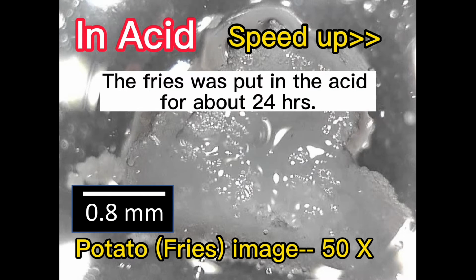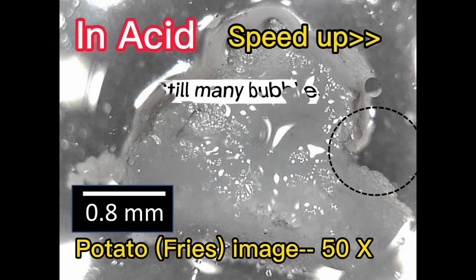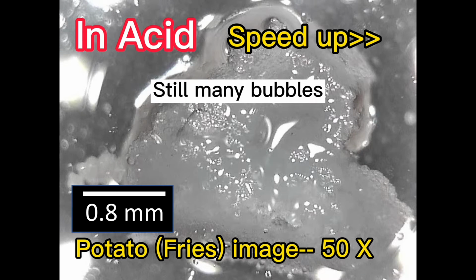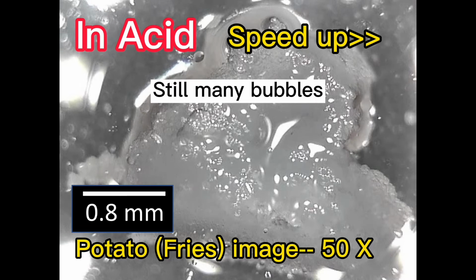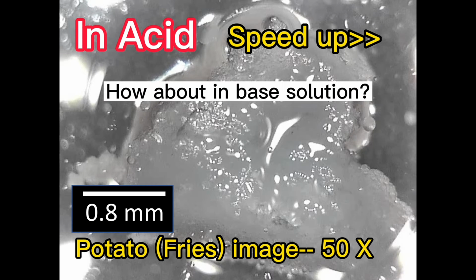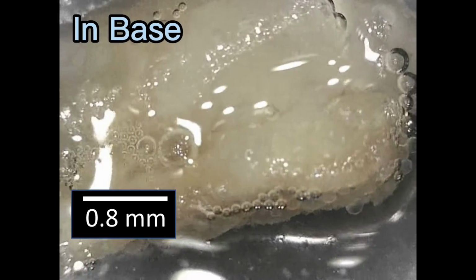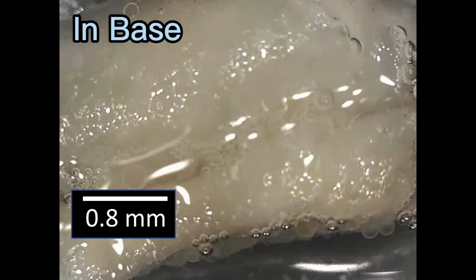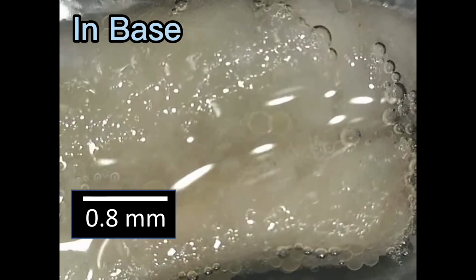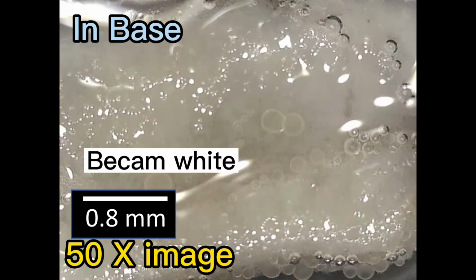The fries were put in the acid for about 24 hours, and we can still see some bubbles. How about the fries in base solutions? Let's do it. Just like putting the fries in an acid, the fries turn white instantly when put in an alkaline solution.